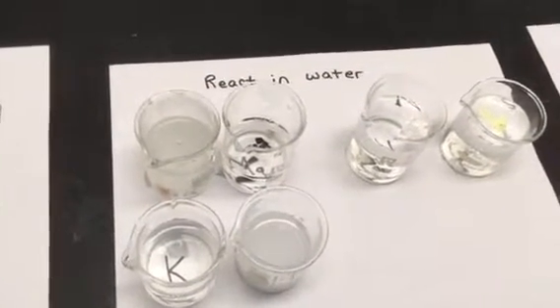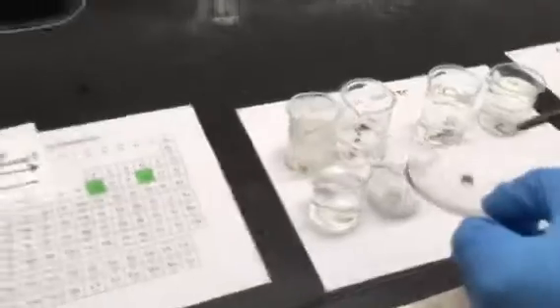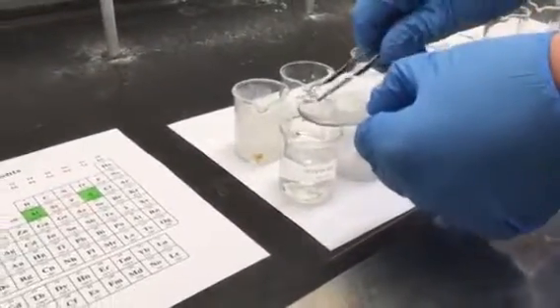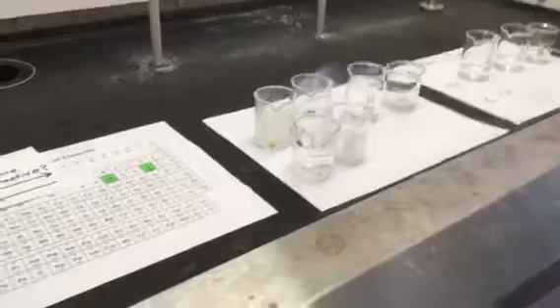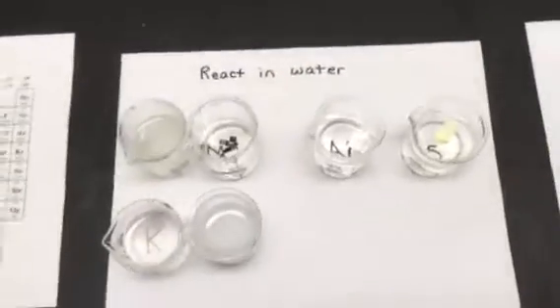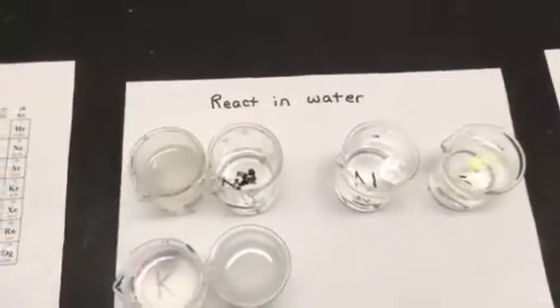So it seems to be a pattern emerging now. Calcium did react, sodium reacted. Now we're going to take a piece of potassium and put that in. It gives off a purple flame. And there you go. So that was potassium. Okay. So we have a bit of a pattern here, but like I said, we need to take a look at these three again. We don't really have a pattern in these three because they all did nothing in water.